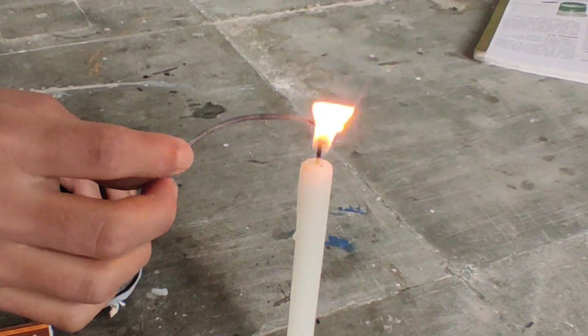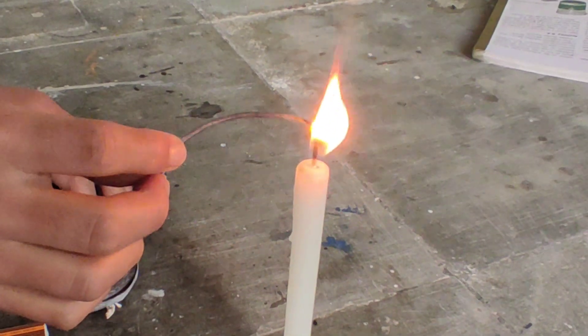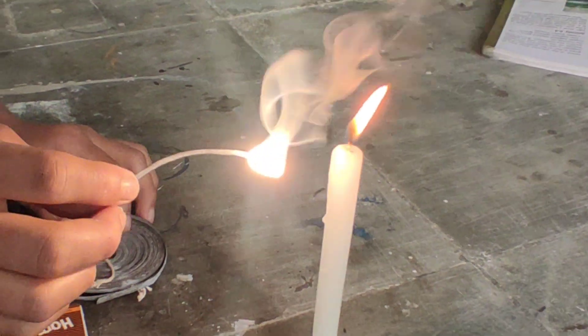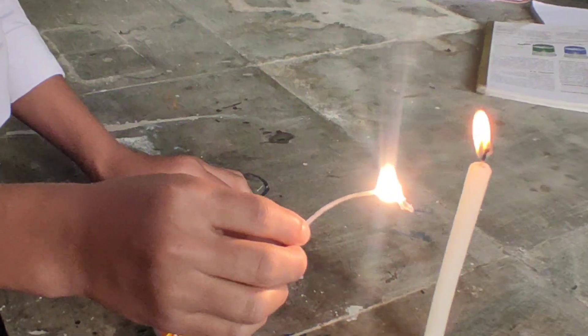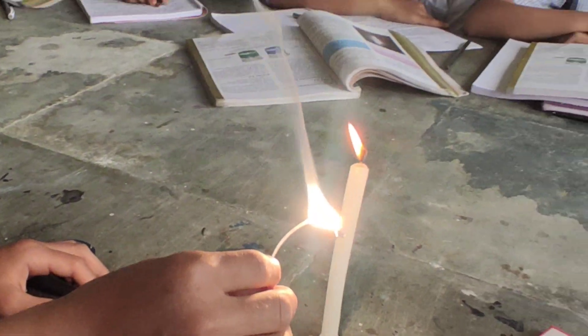In this process, magnesium metal reacts with oxygen to form a white powder, which is called ash, with the release of heat and light.